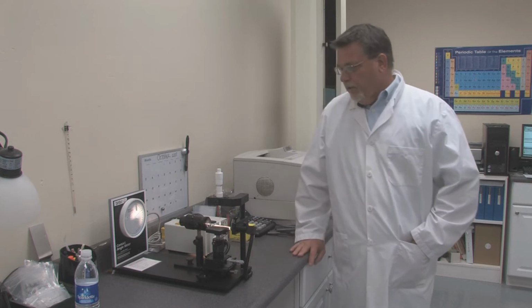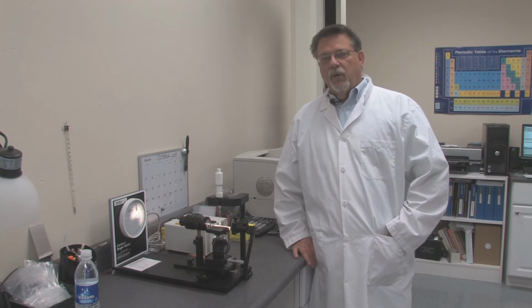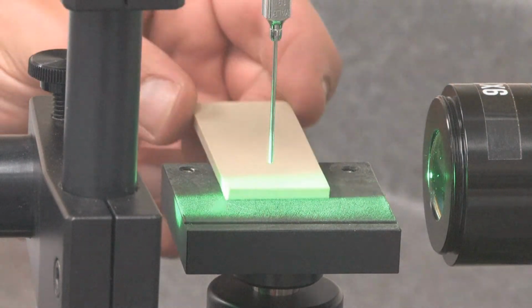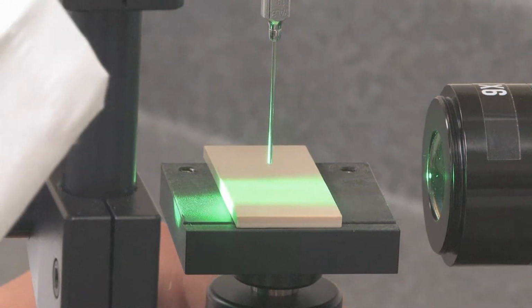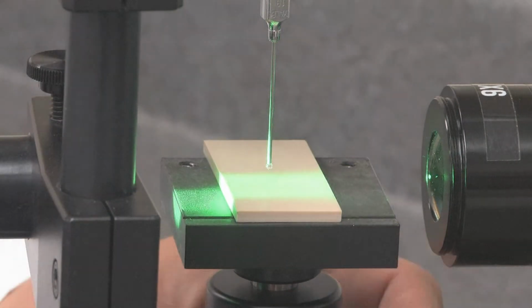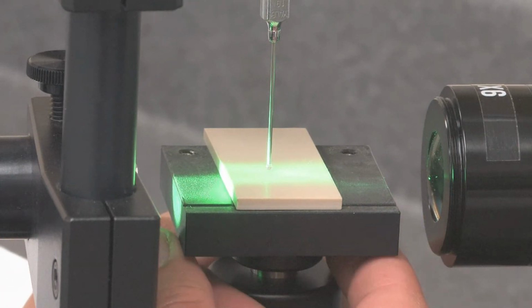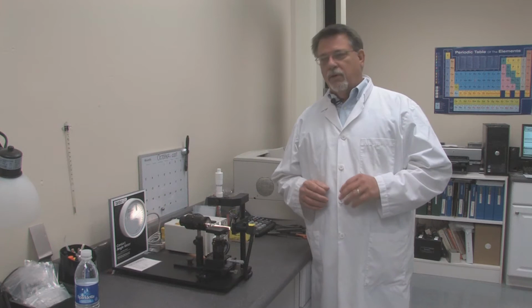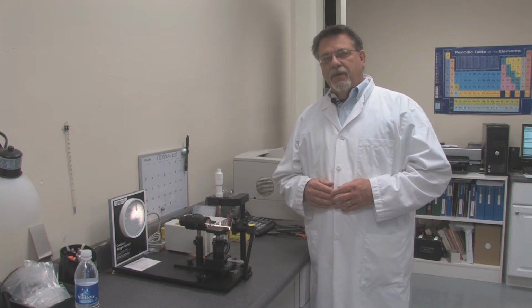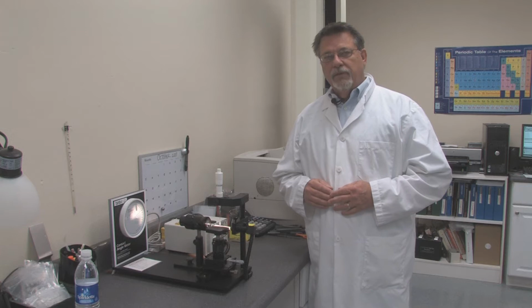First thing we're going to talk about is our goniometer. Now, a goniometer is a fancy name for a device to measure surface tension. What we do with this device is look at materials before we treat them for enhancement, and then after. We're trying to be sure that we're generating the right surface structure to meet whatever the customer's requirements are, whether that's hydrophobic or hydrophilic. This is the mechanism that we use to test it, and we do that by simply looking at the contact angle of that material.